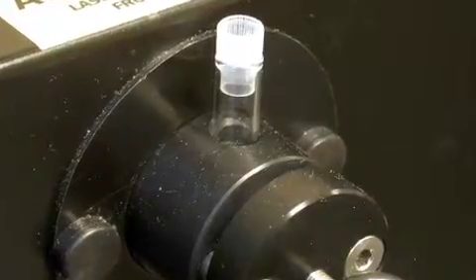When you have only a small amount of sample to work with, you can put your sample in a melting point tube. Ask about using the adapter if you wish to work with the smaller sample size.